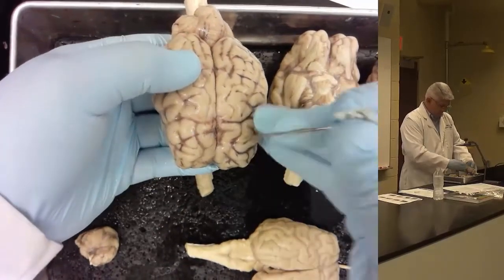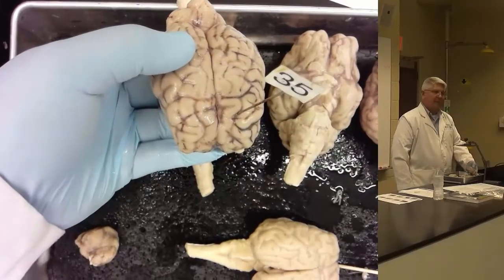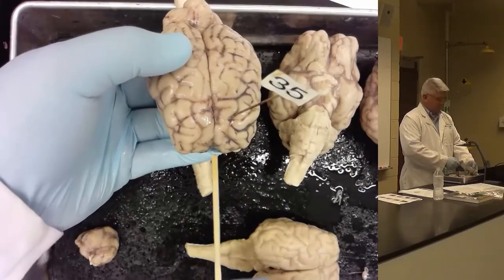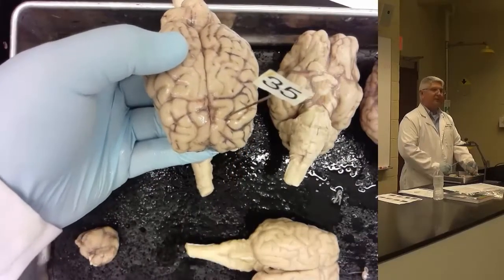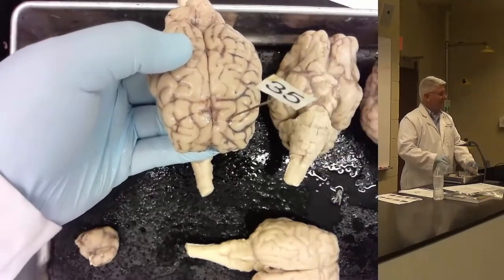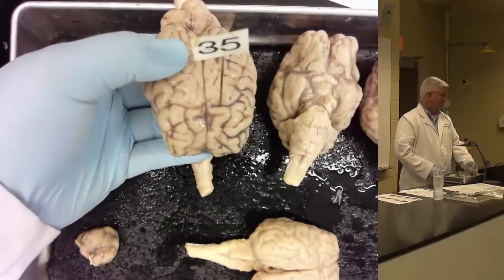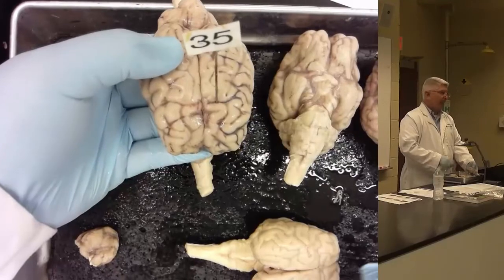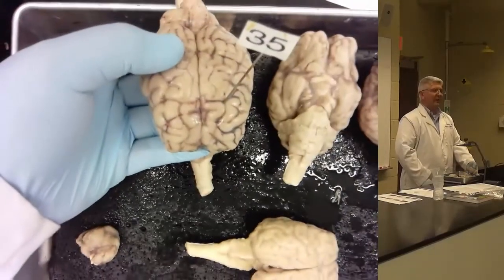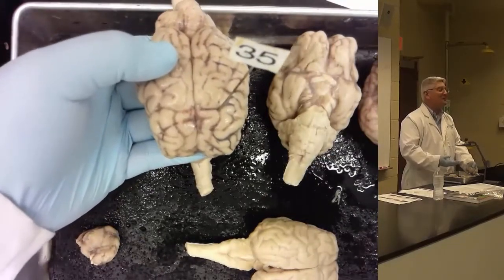If I were to mark the superior frontal sulcus, I would have a pin stuck in like that. It is clearly in the sulcus. You can see your landmarks of superior and middle gyri here. It's not near the cruciate fissure up there. If I'm going to mark the cruciate fissure, I'm going to mark it here. I will never put a pin at the juncture of the cruciate and the superior frontal sulcus. Believe me, I'm really trying to be obvious with this.